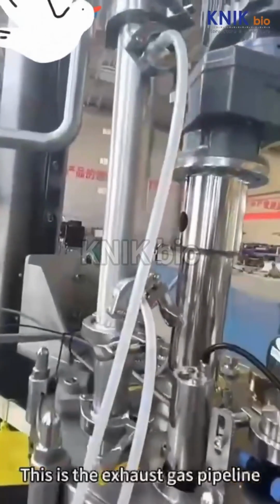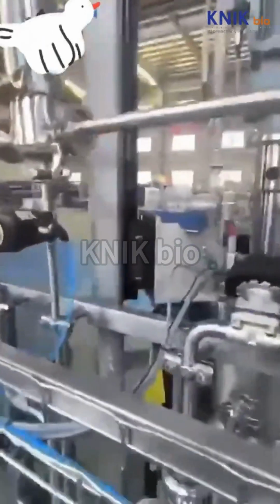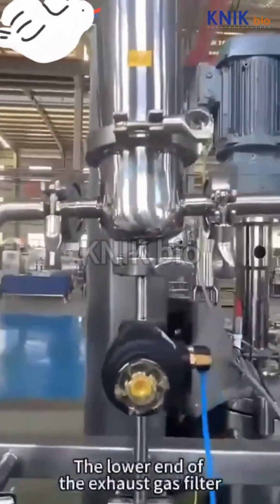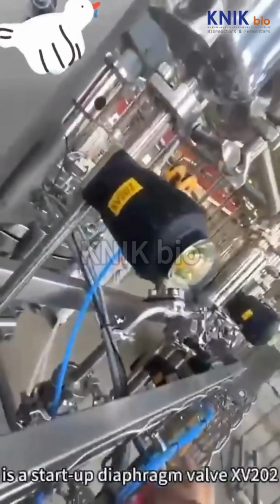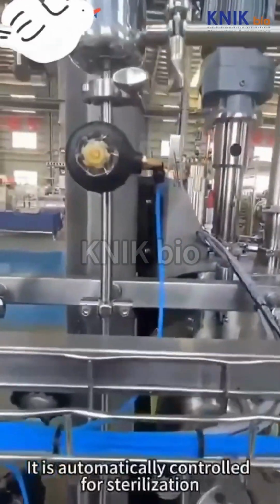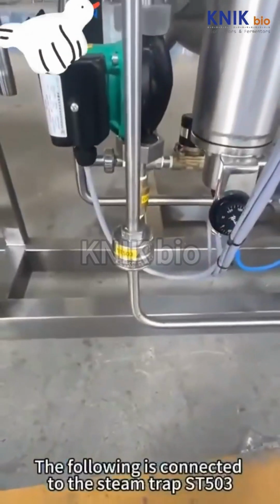This is the exhaust gas pipeline. The exhaust gas will pass through this condenser. After passing through the exhaust gas filter FL201, the lower end of the exhaust gas filter is a start-up diaphragm valve XV202. It is automatically controlled for sterilization. The following is connected to the steam trap ST503.